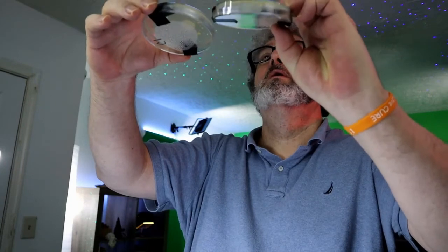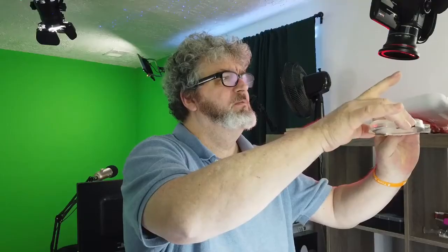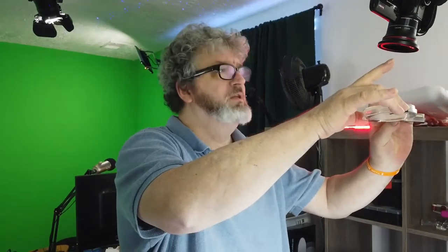So, I would say there's a reduction in the amount. Maybe to the tune of about 40%. That's just an assessment based on me eyeballing this. What I would like to say is I do believe that there has been some reduction. Now this was one treatment of this. If you did this every night to whatever you were putting in there, I think 100% you're going to end up with this device cleaning what's in there, which tells me that this device probably works.